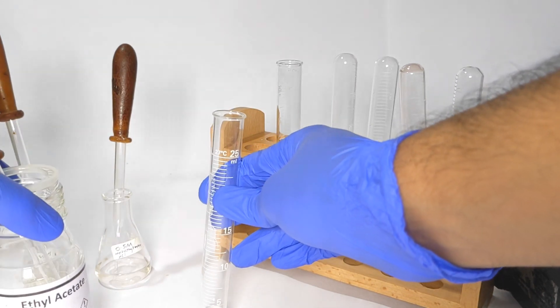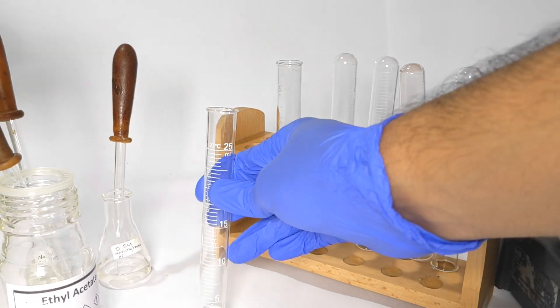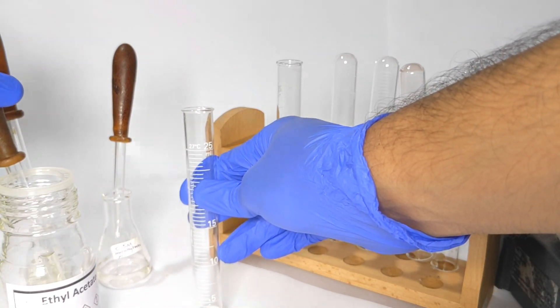Next add 8 drops of the ester. In this case I used ethyl acetate, one of the simplest esters.